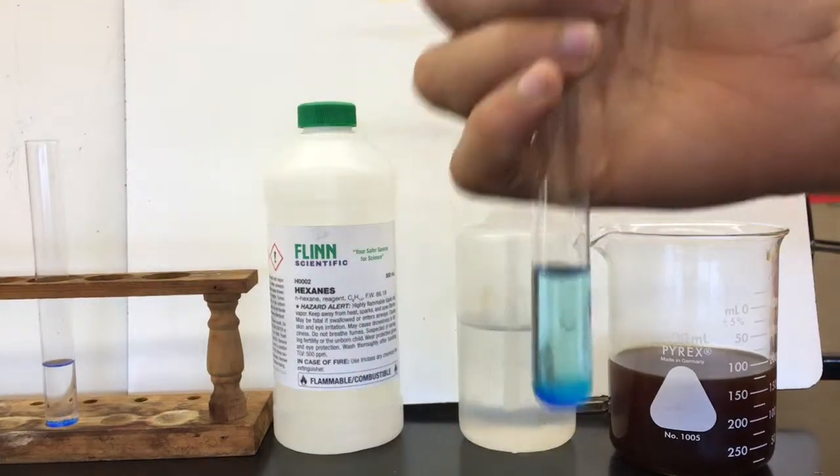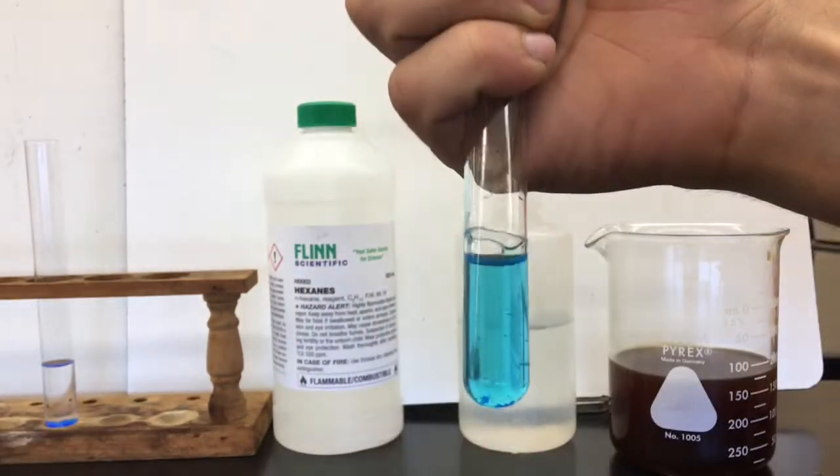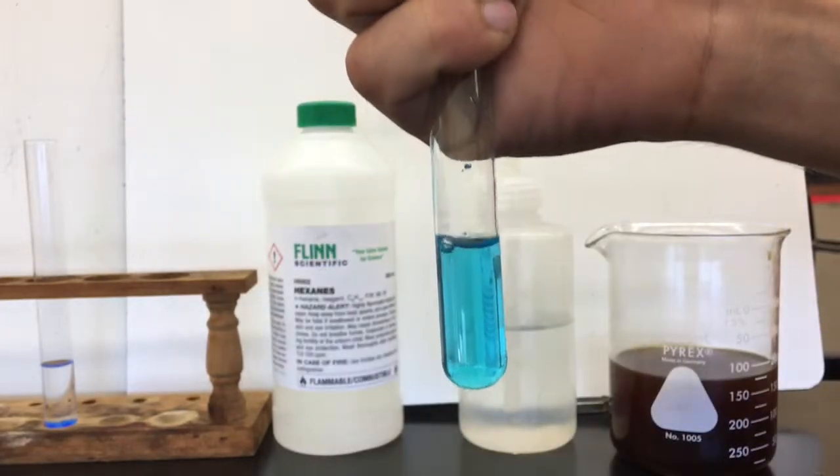Let's give the water a check for solubility. One thing I'm going to do here to help is I'm going to just invert it real quick and see if the copper dissolves.